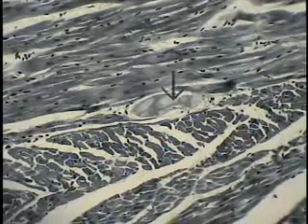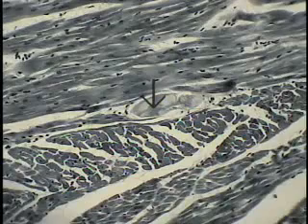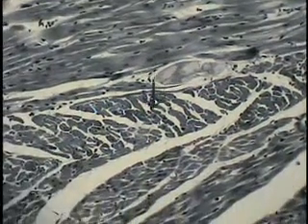A little bundle of Purkinje cells down into the interior. Usually you don't find them this far down or into the interior of the muscle wall, and so we're getting this interwoven pattern of cardiac muscle cells as one courses through, and finally ending up at this thick fatty layer on the external surface, which indicates that the epicardium is now being visualized.